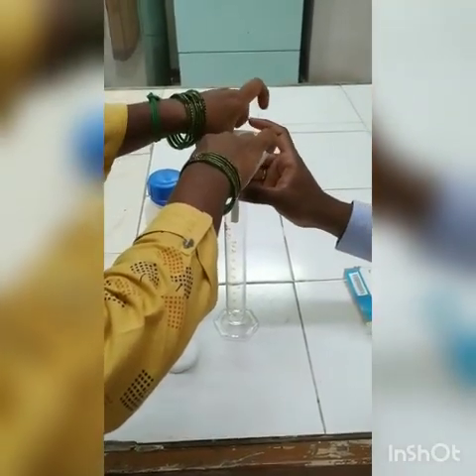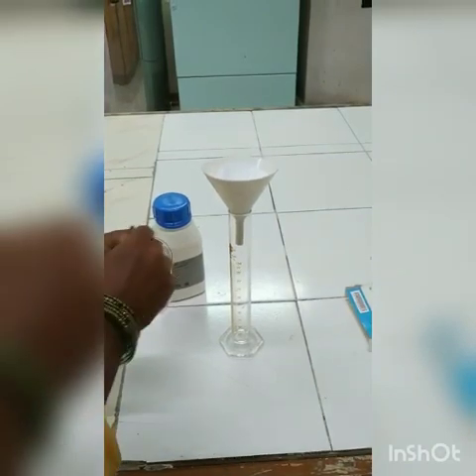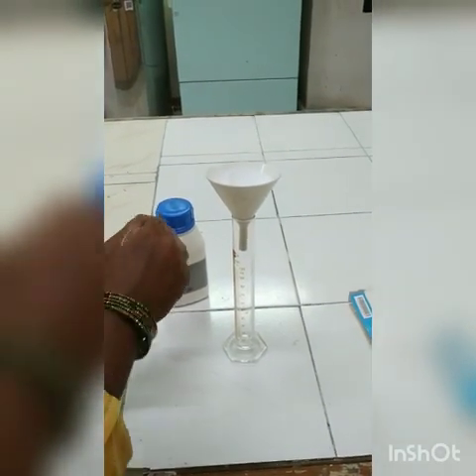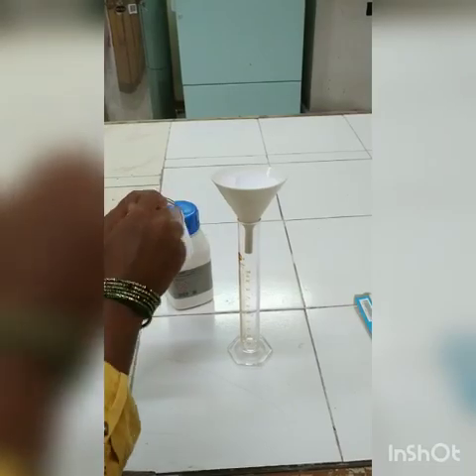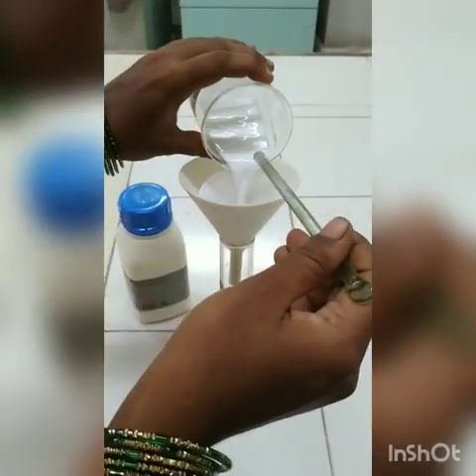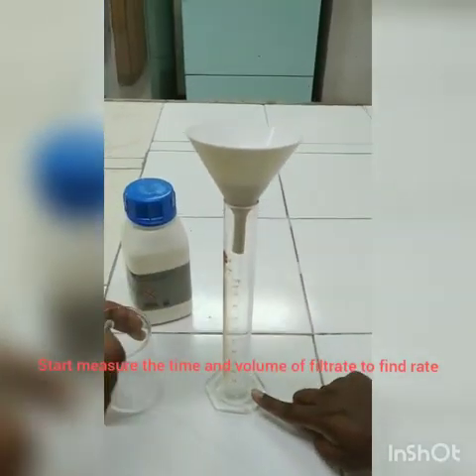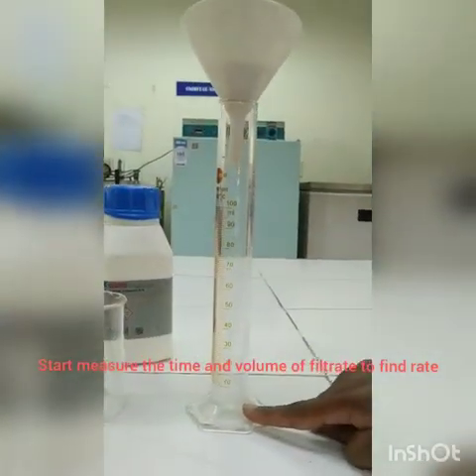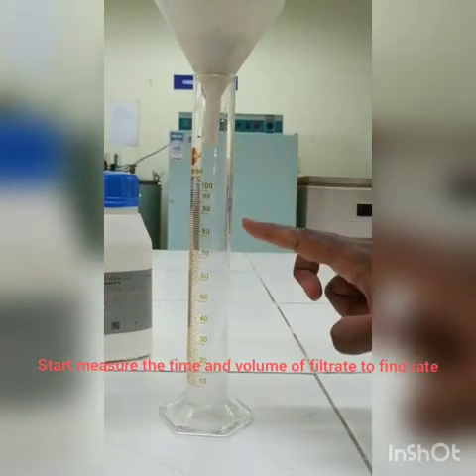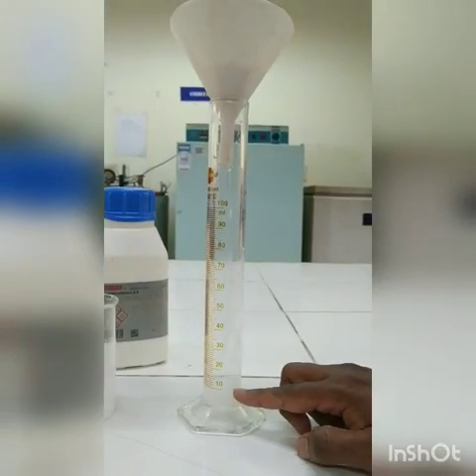and the funnel has to be kept over this measuring cylinder, and this calcium carbonate water mixture is poured from the top of the funnel through the filter medium. We need to pour at once, and you need to start measuring the volume of filtrate being collected. Okay, the liquid collected from the filter medium is the filtrate. So with respect to time, we need to measure the volume.